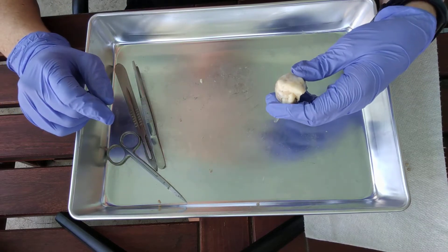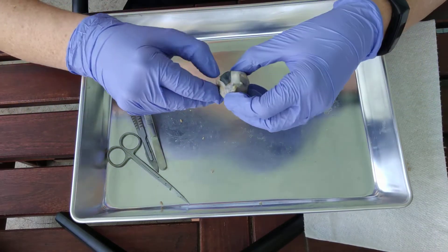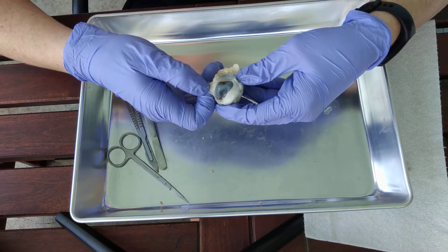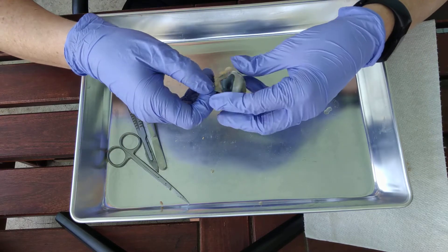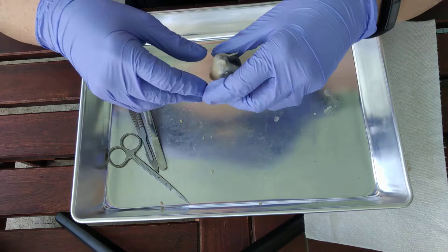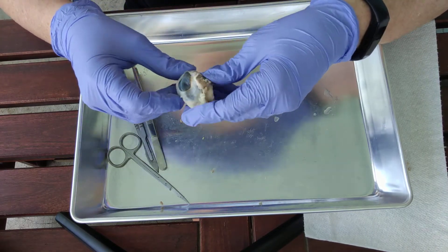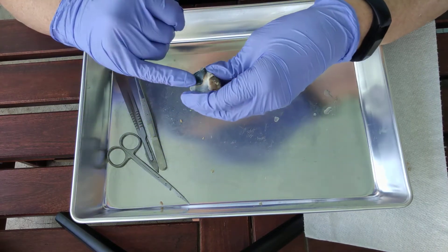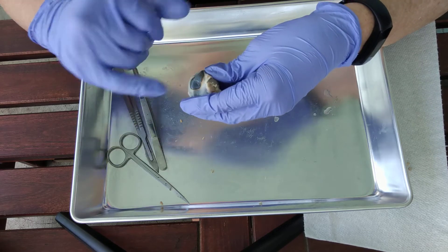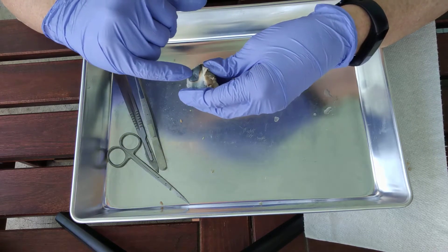Hello everyone. Today we are going to be looking at the sheep eye and we'll dissect it together and find all of the structures. The first thing we want to do is orient ourselves. Right here would be the front of the eye — the anterior part — and that would be the cornea right there.